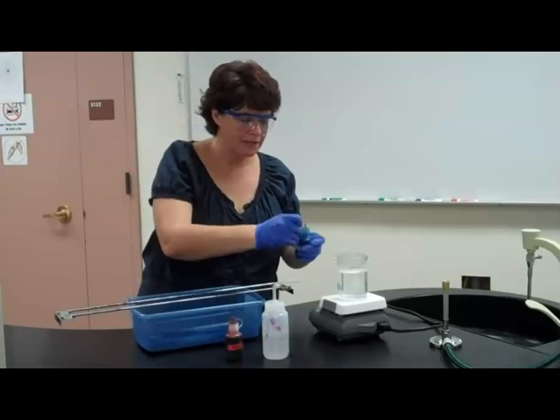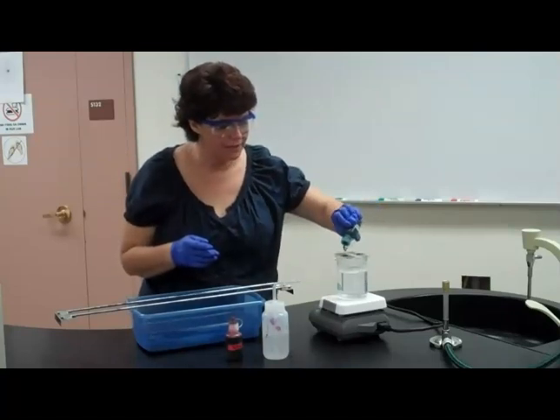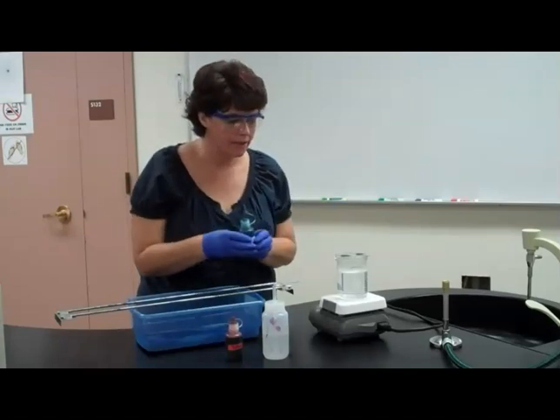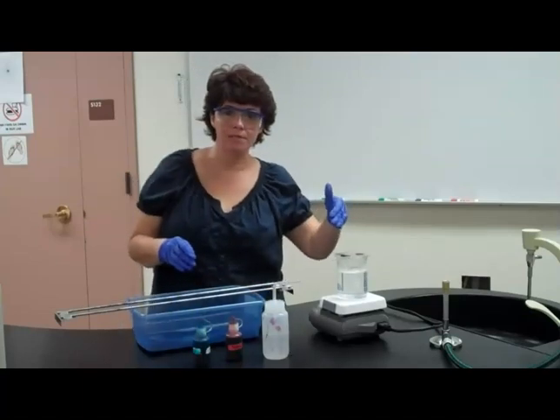As we did with the acid-fast stain, we're going to drop the stain on there. The first stain in the endospore stain is called malachite green. So we're going to put our malachite green on there, making note not to get too much in the water. That is going to steam for the 5 minutes.